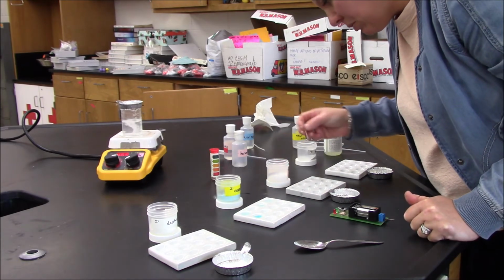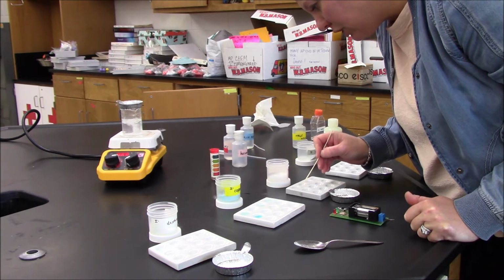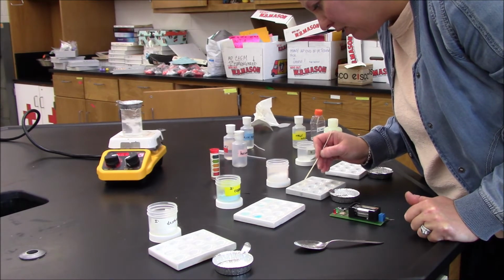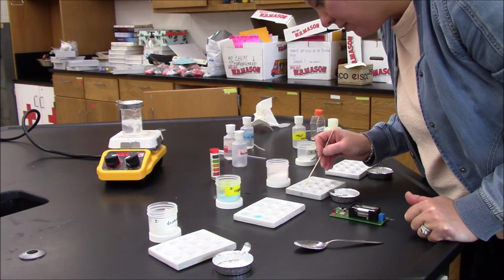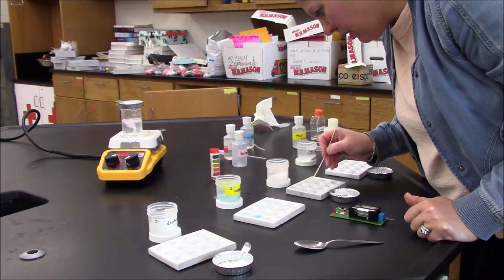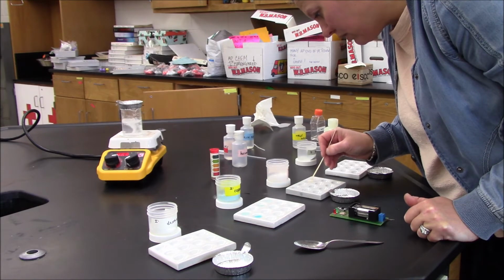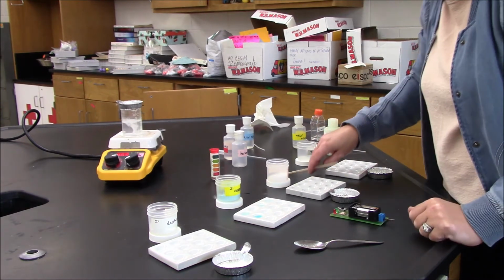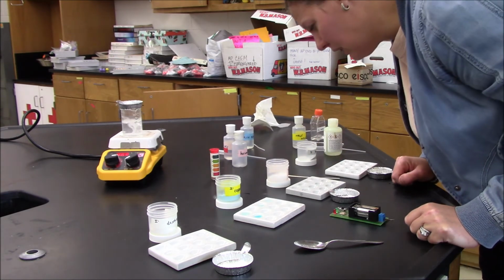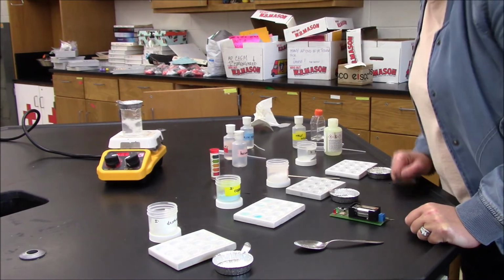Continuing to monitor what's going on here in the hexanes, and it definitely looks like the paraffin wax is changing. It's getting smaller. I'm going to go ahead and say that this is what it looks like if it's dissolving. And here, definitely also starting to dissolve in the ethanol. So we can say that it's slightly soluble in the ethanol and soluble in hexanes.